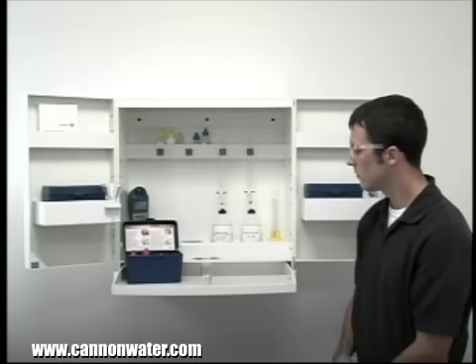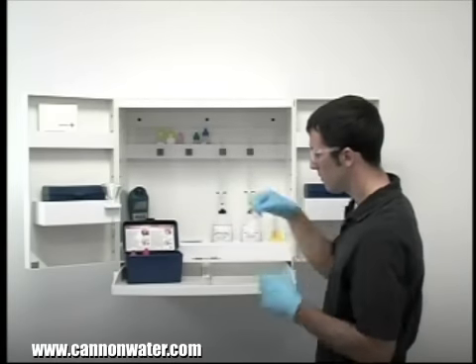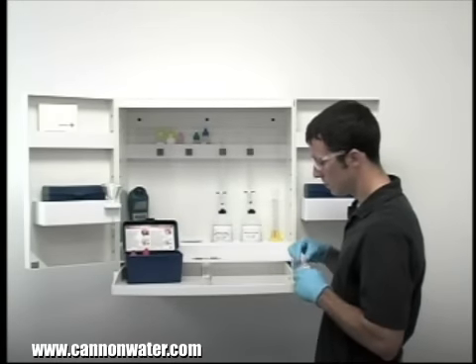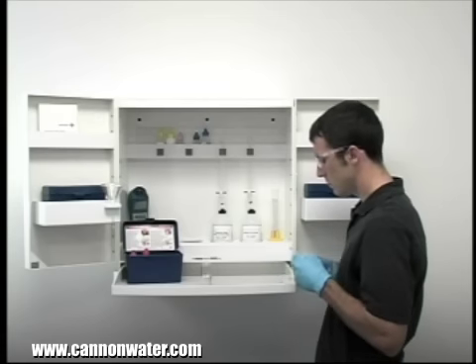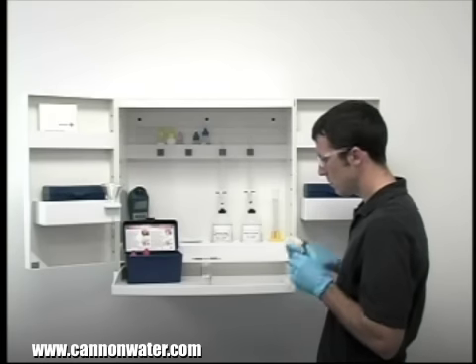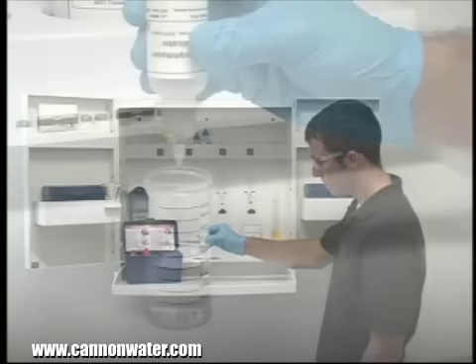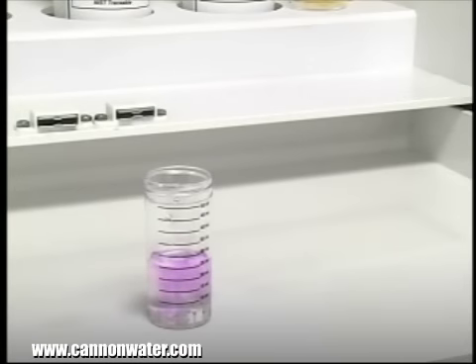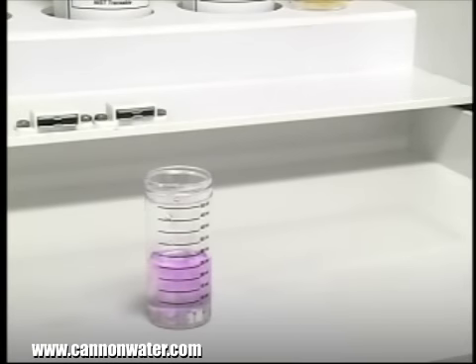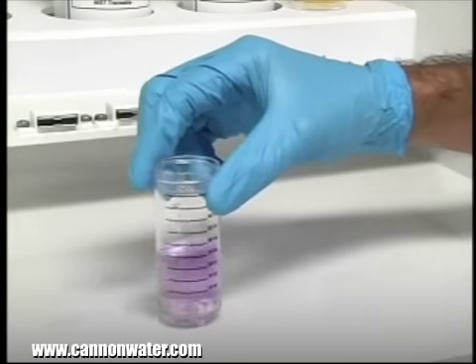The next step according to the endpoint ID procedure is to add three drops of phenolphthalein indicator. The bottle contains a dropper tip, so it's important to hold the bottle vertically to get a consistent drop size. After the addition of each reagent, it's important to swirl the vial to make sure the reagents are properly mixed.